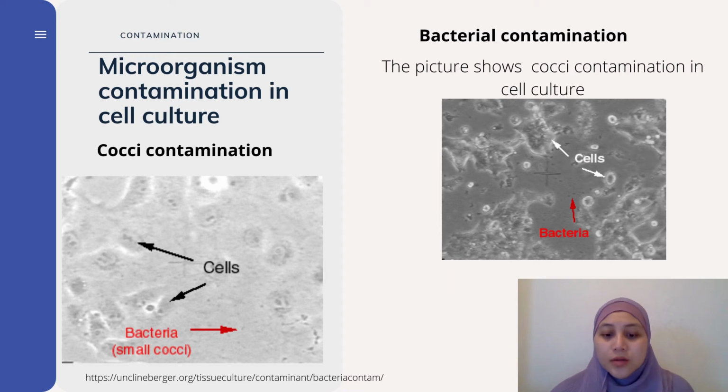Some bacterial contamination can also be due to cocci bacteria as a source of bacterial contamination. Have a look at the picture. I hope you can appreciate the presence of small cocci in between the cells.